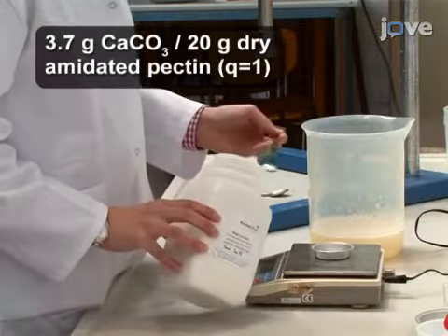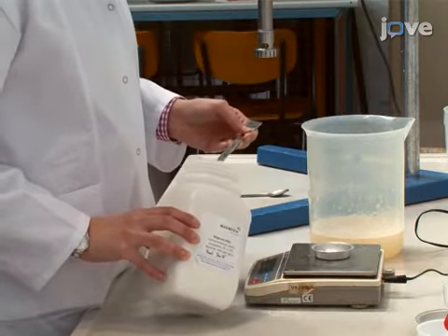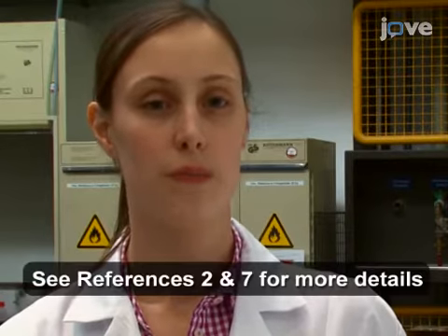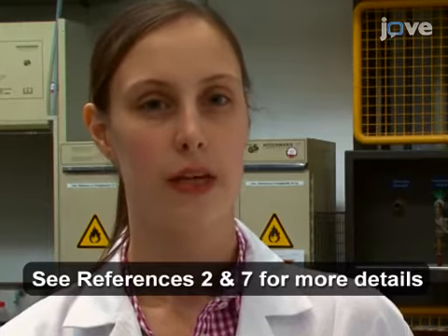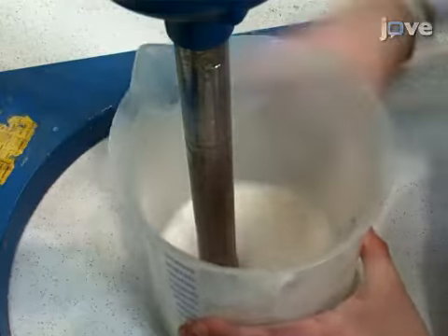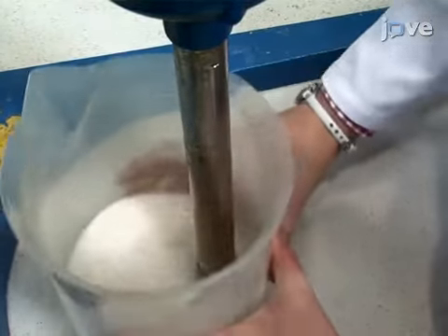Next, weigh out and mix in the calcium carbonate. It is not necessary to adhere to this degree of cross-linking. However, too much cross-linker can lead to reprecipitation and negatively affect the surface area of aerogels. Finally, homogenize the mixture at high speed again until a white homogeneous dispersion is obtained.